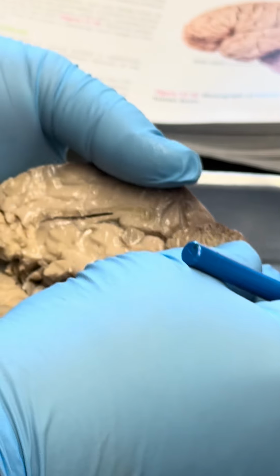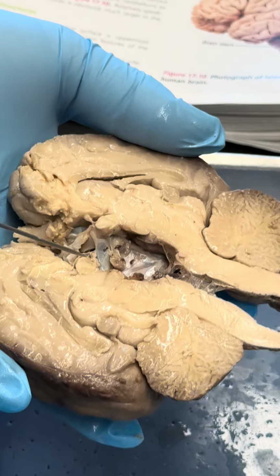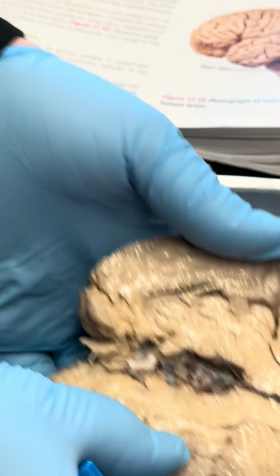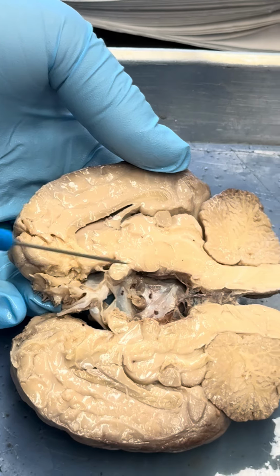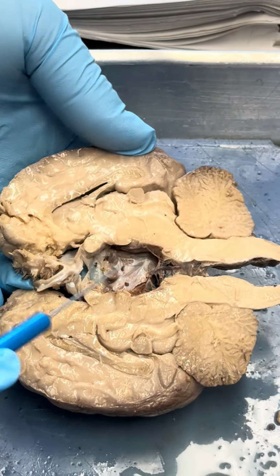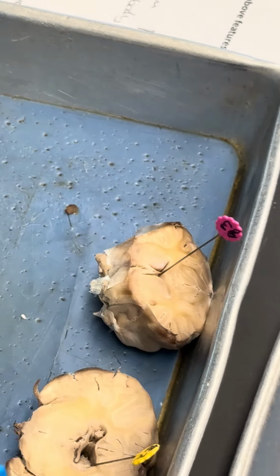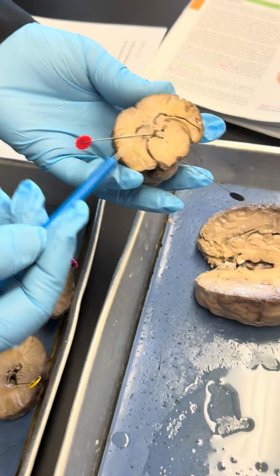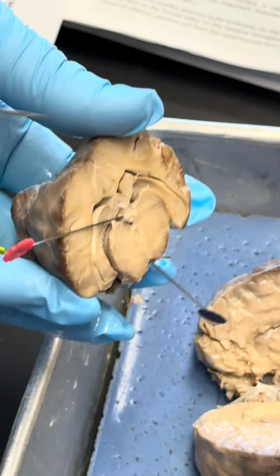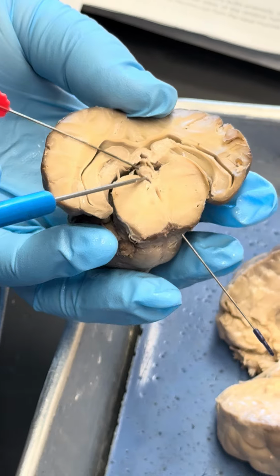what we see down here, that is the pineal gland. So pituitary gland was down here. This is the pineal gland. And here again we see the optic nerve, or the optic chiasma, which has been cut. And then I want to show you the pineal gland in this view. So that here is now a coronal view, a coronal cut, so a frontal cut. That is the posterior side of the brain. And what we see here, this is the pineal gland.